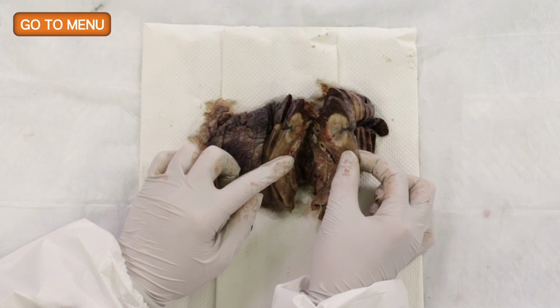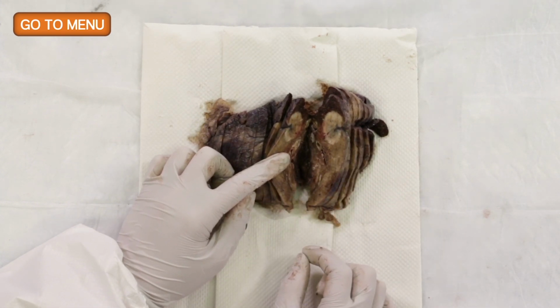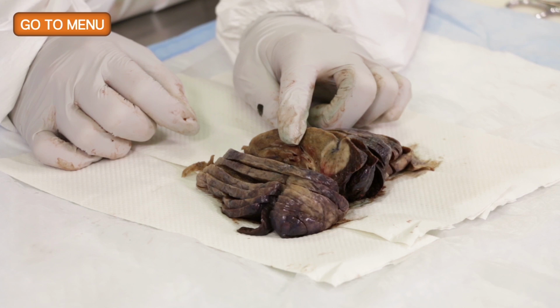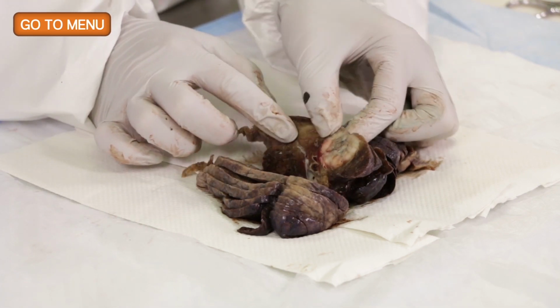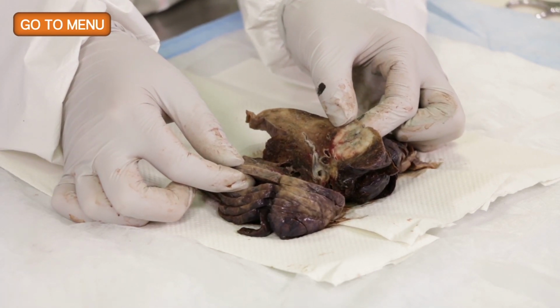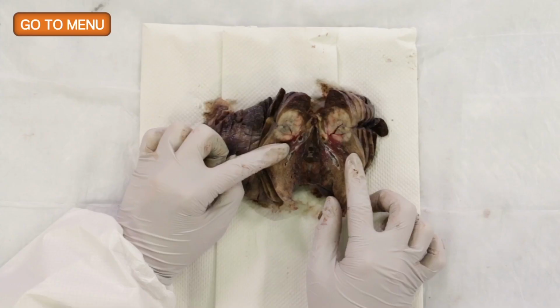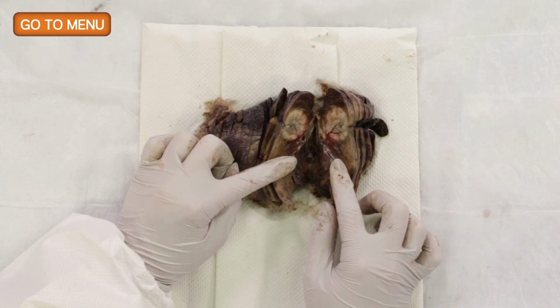And so as you look at it, what are the things that you're thinking about: the color, the texture, and the relationship to the pleura? And also the location, peripherally located, I would think of adenocarcinoma. In addition, the color of the cut surface is a bit variegated. At the very periphery, it's tan to white, but at the center, it's a little grayer and browner, and also it's a little bit depressed.